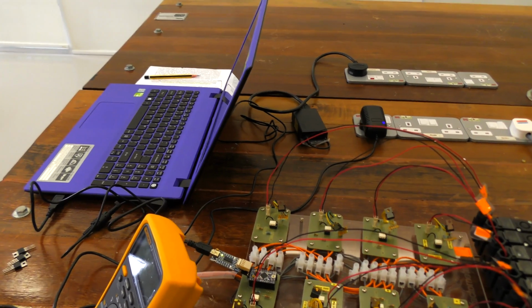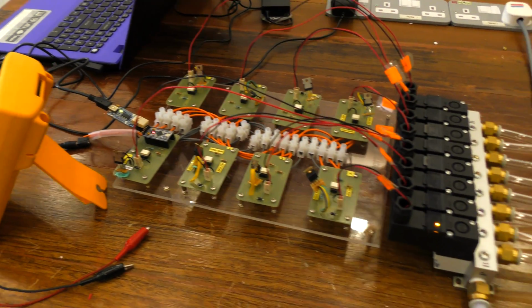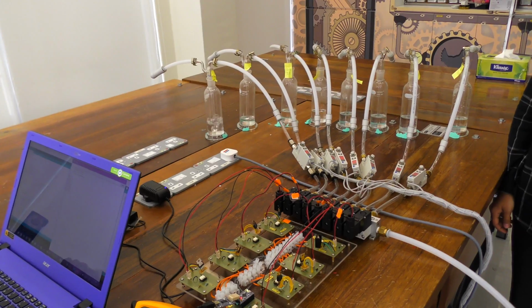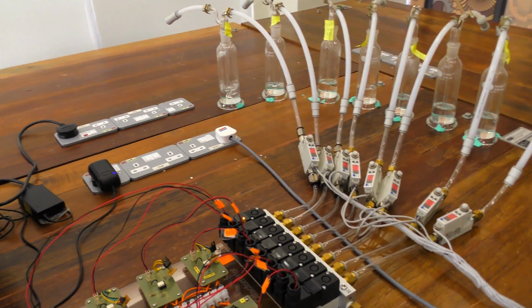Right now we are working on the development of a laboratory olfactometer that will produce aromas in a precise and controlled manner. It also produces a constant humidified flow of pure air. This airflow runs continuously to the subject's nose.